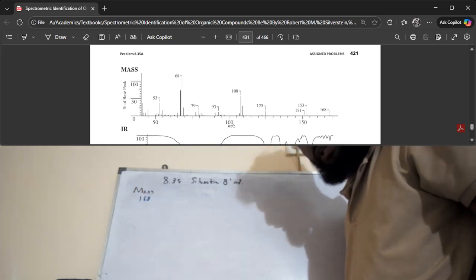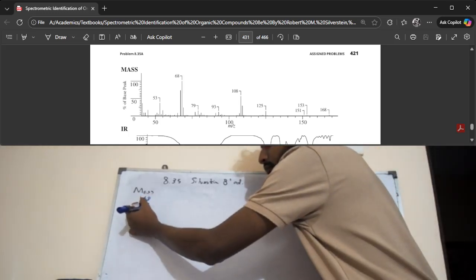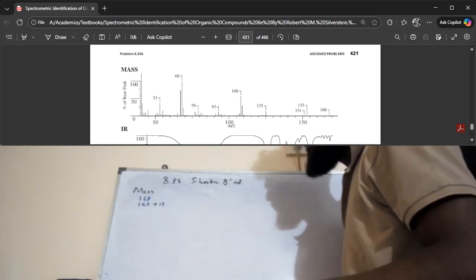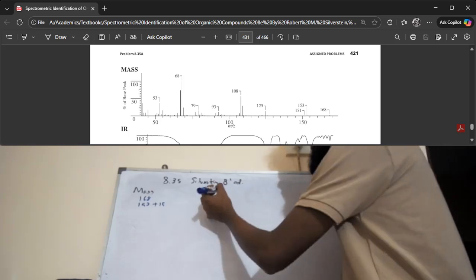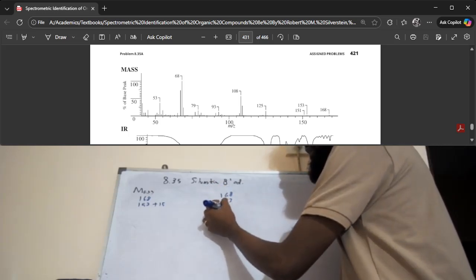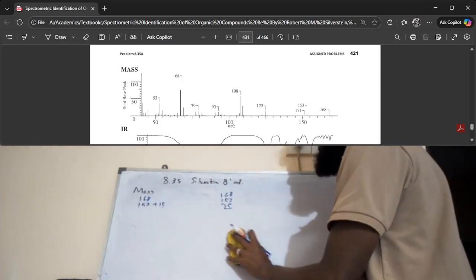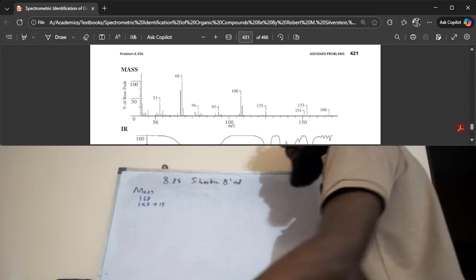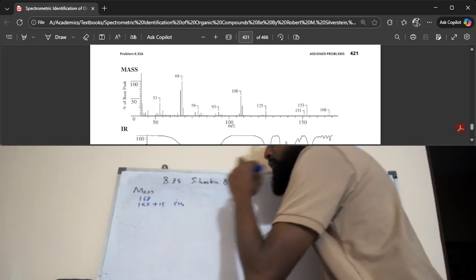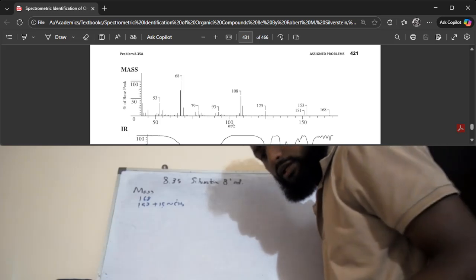We'll also take note of the other peaks. There's a peak at 153. If you consider the difference between 168 and 153, that is 15. So I'm going to write 168, 153, plus 15. That 15 might be a CH3 radical that was removed. Maybe. Okay.